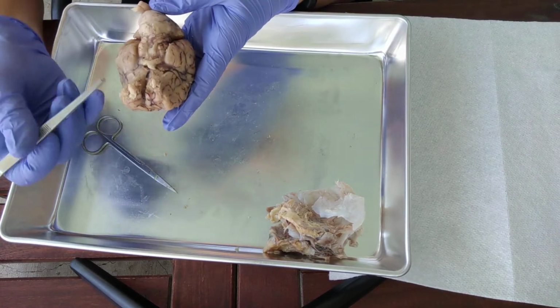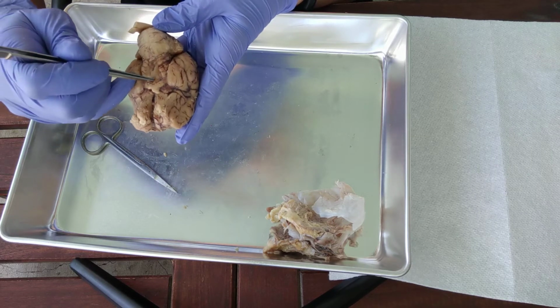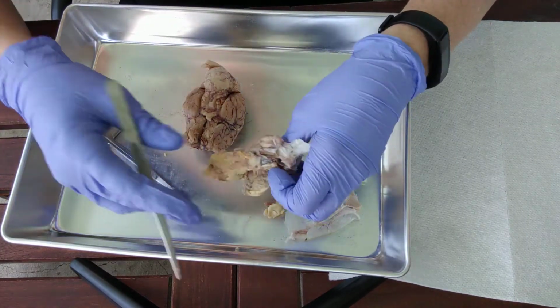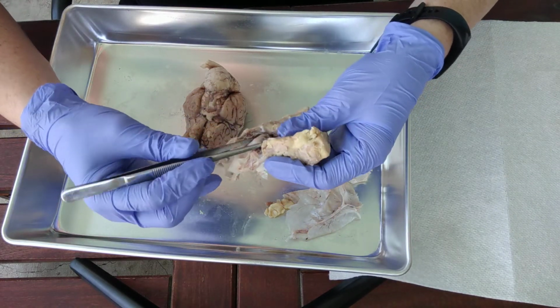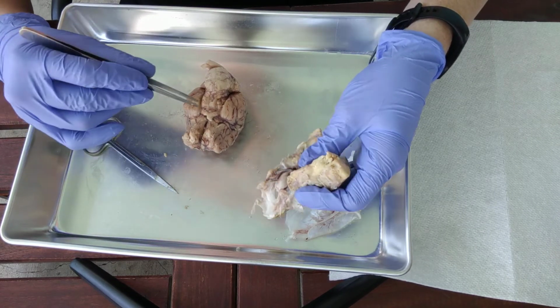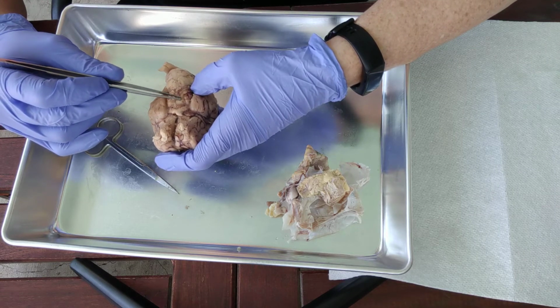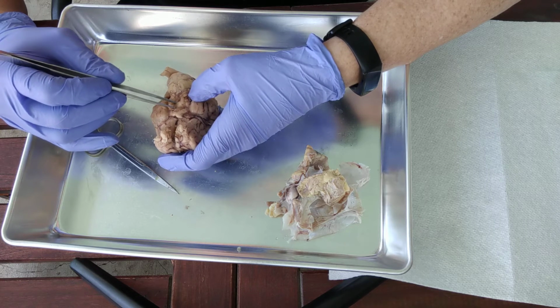Okay, and then following it back, see this kind of darker area, you might see like a little dot structure. This is the infundibulum, and the infundibulum is the little stalk-like structure that used to be connected to the pituitary. So again, we remove the pituitary. Here it is. There's the pituitary still embedded in the dura mater. And the pituitary would sit right here, and the infundibulum is the little stalk-like structure that connects and holds on to that pituitary gland.